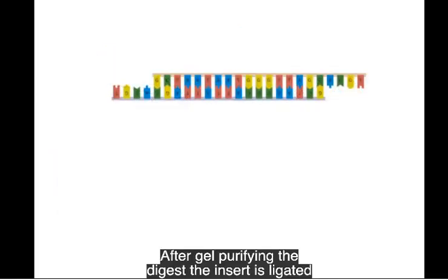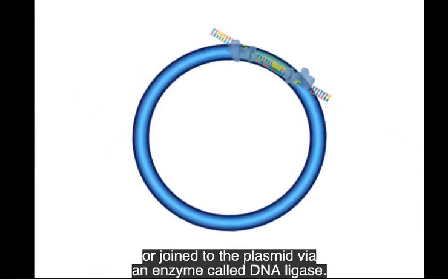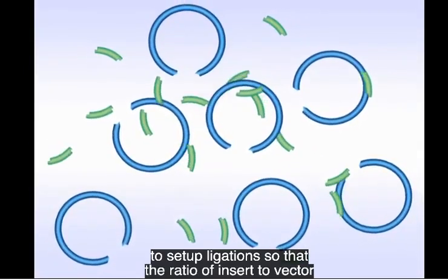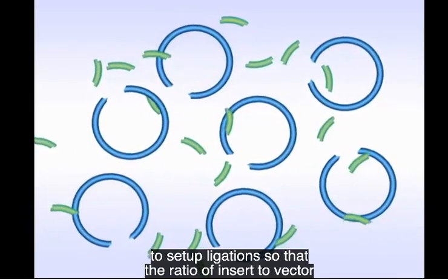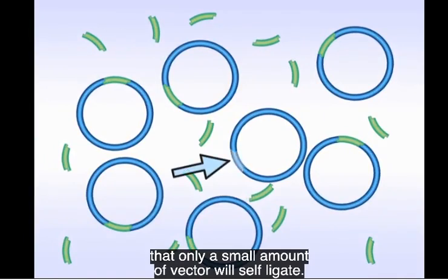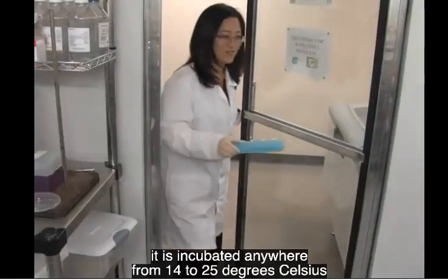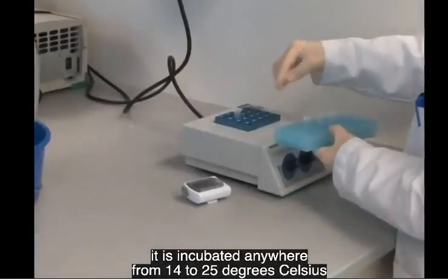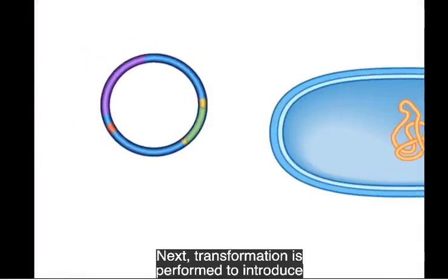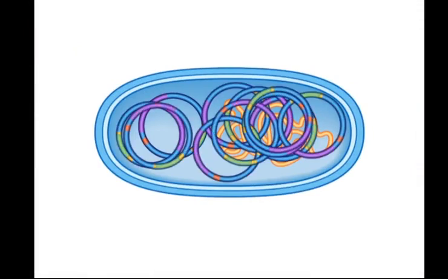After gel purifying the digests, the insert is ligated or joined to the plasmid via an enzyme called DNA ligase. Generally speaking, it is always a good idea to set up ligations so that the ratio of insert to vector is 3:1, which ensures that only a small amount of vector will self-ligate. Once the ligation has been set up on ice, it is incubated anywhere from 14 to 25 degrees Celsius from 1 hour to overnight. Next, transformation is performed to introduce the plasmid vector into the host that will replicate it.